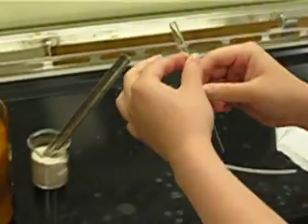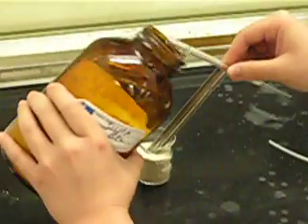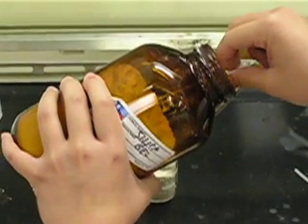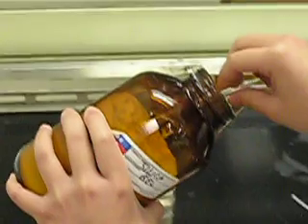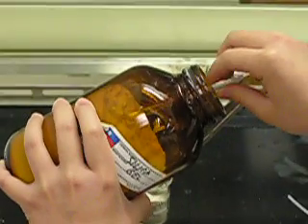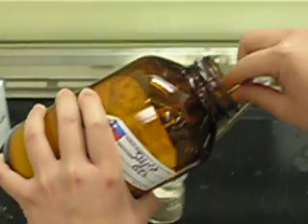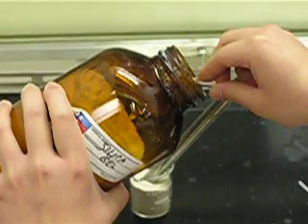Then take it to the silica jar and start loading silica up. It's important to do this inside the jar so silica won't spill out, because silica is toxic and can stay in your lungs for 20 or 30 years. By doing it like this, it won't fall out and won't harm you.